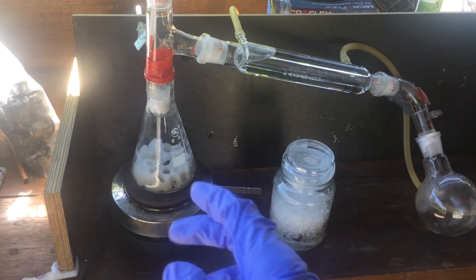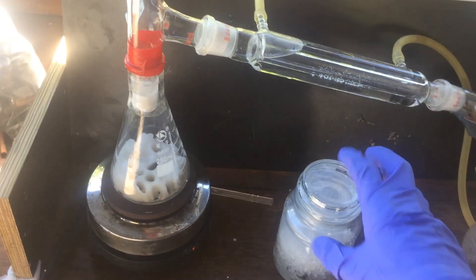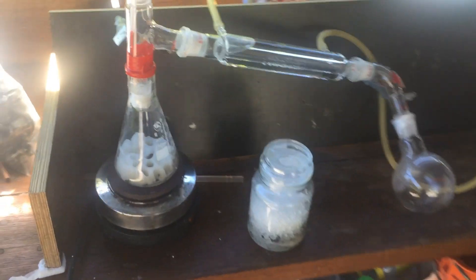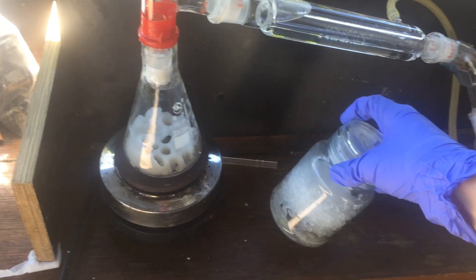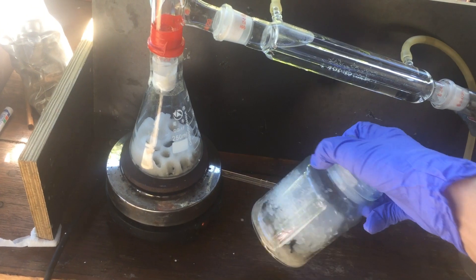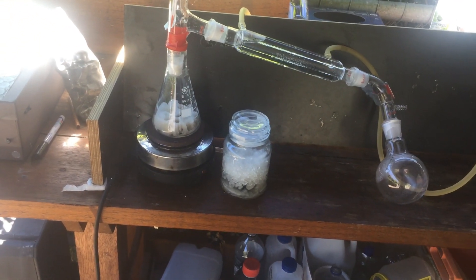I'm not too happy about how much water I was actually able to get out of the sodium carbonate, because unlike sodium sulfate like we had before, it's a little bit tricky to dehydrate the salt. I'm pretty sure this is all still hydrated sodium carbonate, so it's still got a fair amount of our heavy water in it. What I'm going to do instead of just heating the salt — which kind of cracked the glass of the Erlenmeyer flask — is make a little desiccator bag with some anhydrous sodium sulfate to absorb all the water moisture content of the sodium carbonate. Hopefully that'll get rid of all the water from the sodium carbonate, and it will be absorbed into the sodium sulfate, which is a lot easier to remove the water from.